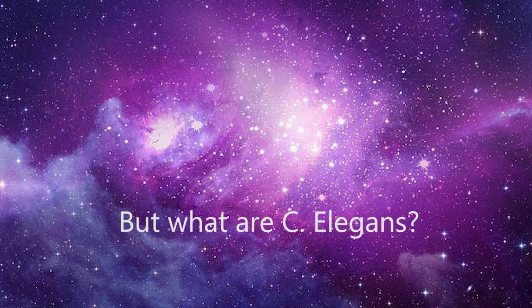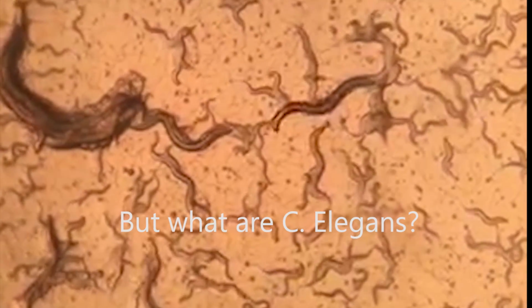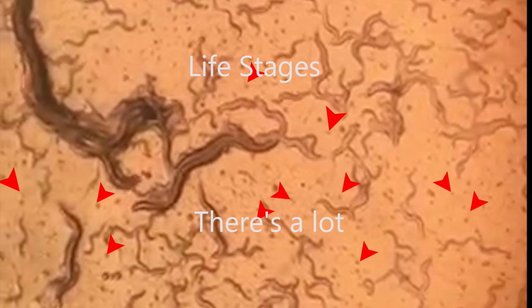We need to address why we even use C. elegans in this experiment. Well, we use the C. elegans because they make ideal model organisms. Their DNA is very similar to humans, they have a short lifespan of 3 days, and they reproduce frequently. As an added bonus, they live off bacteria, making it easier to apply the double-stranded RNA to silence genes in their systems.